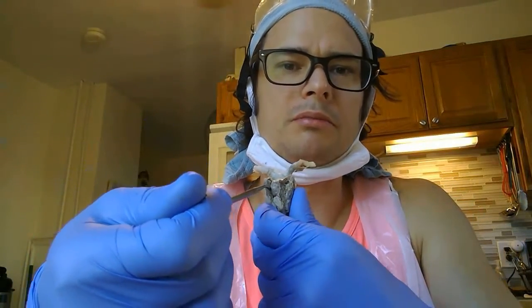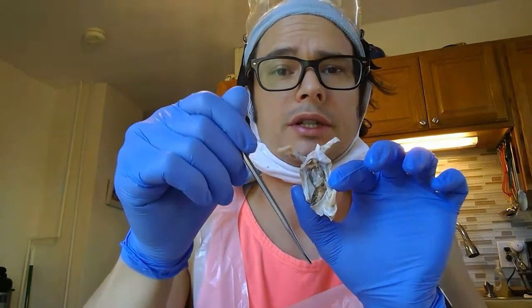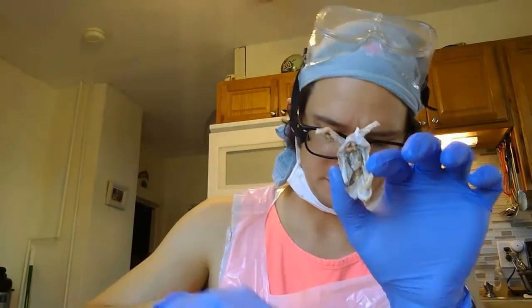This helped me out quite a bit when I simply removed the medulla oblongata and most of the cranial nerves. So right here I have part of the midbrain and the brainstem, and I removed the portion where it was going down right here with the start of the spinal tract and the brainstem.